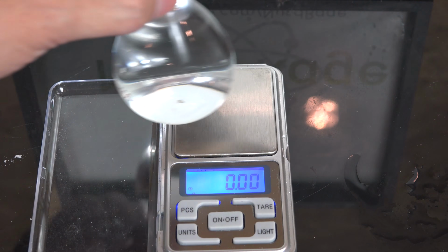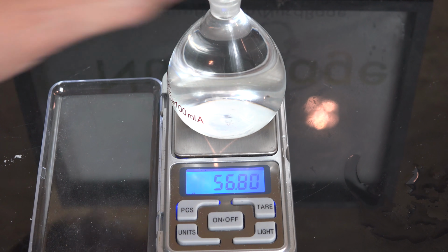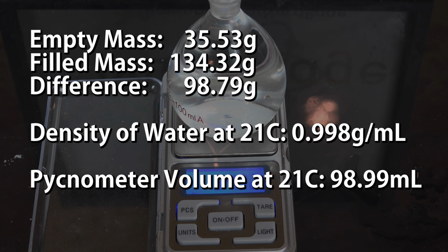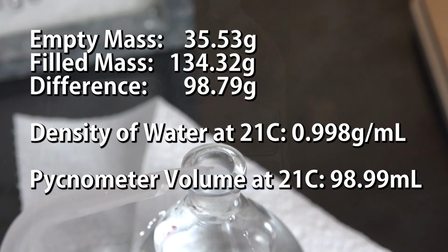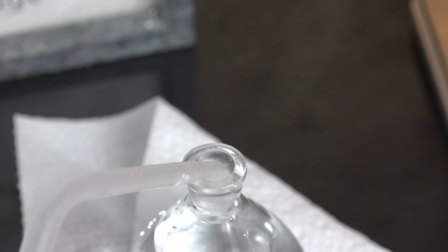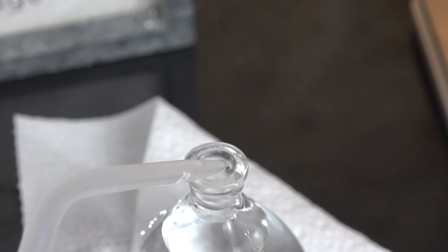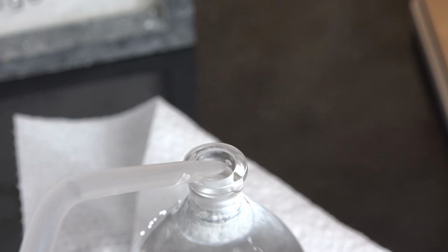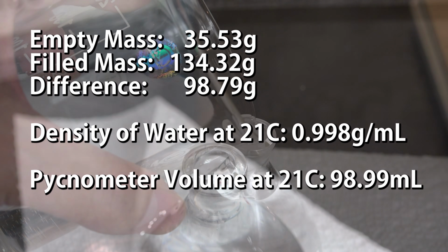Then we measure the mass of the filled pycnometer and subtract from it the mass of the empty pycnometer. This gives us the mass of the deionized water inside. We also note the laboratory temperature and find the density of the deionized water for that temperature. Then we divide the mass by that density to give us the exact volume of the pycnometer. In a professional calibration, we would first put the pycnometer in a temperature-controlled bath for half an hour to precisely set the temperature before stoppering it. For amateur work, though, we don't need nearly that kind of accuracy, and consulting a density table is fine.